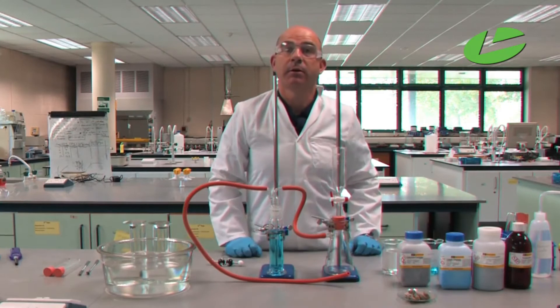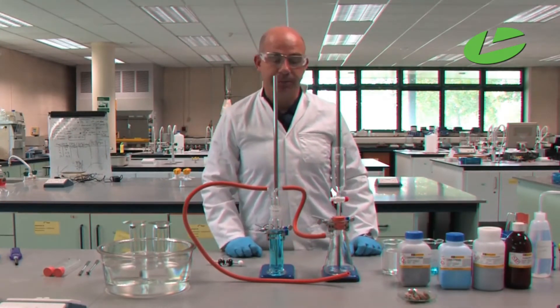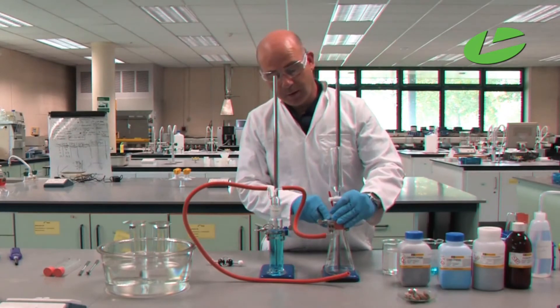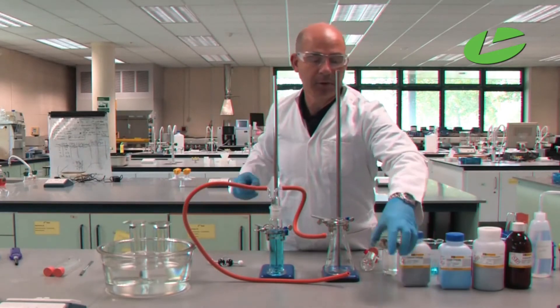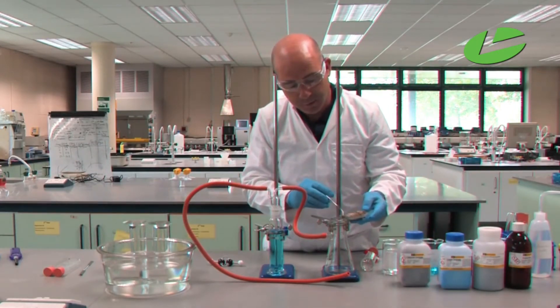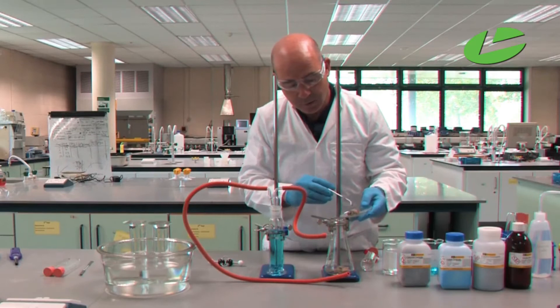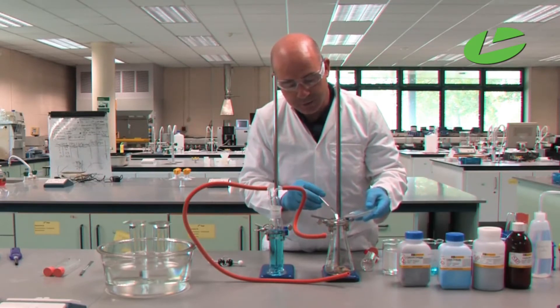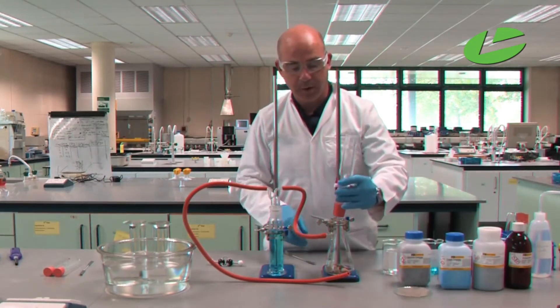Now for the addition of chemicals. Into the Buchner flask, add calcium carbide, which comes in large lumps. Put approximately 20 or 30 grams in the bottom of the container, then put the funnel back on top.